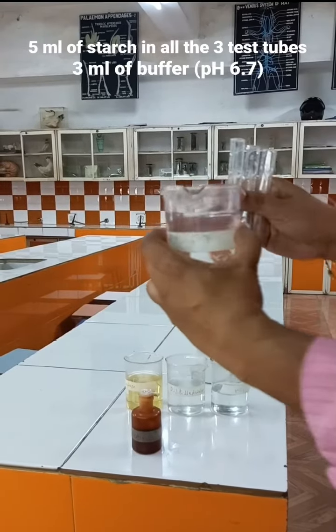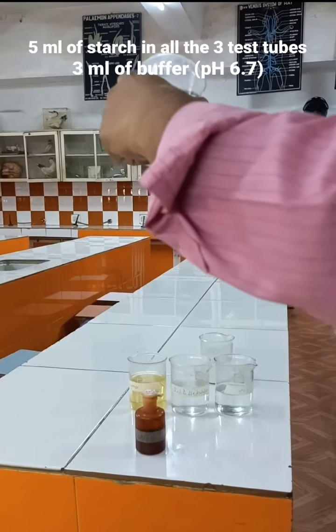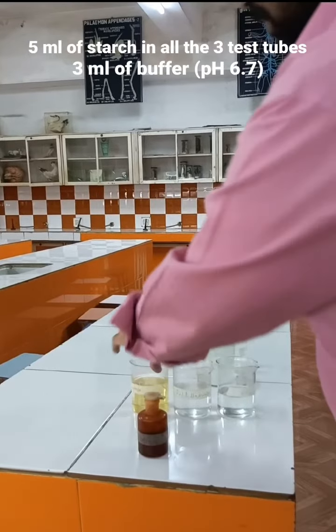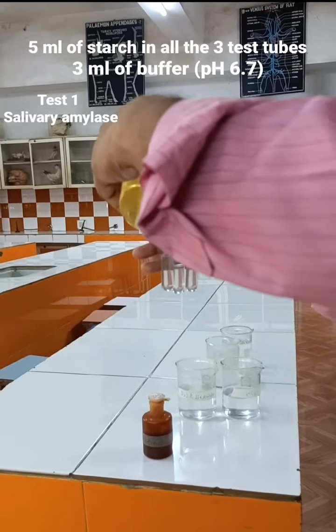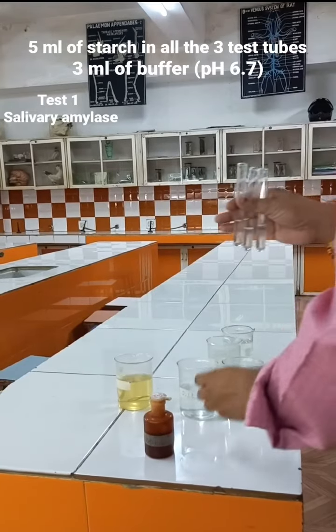To this you add 3 ml of buffer. The pH is 6.7. It's the optimum pH for enzymatic activity. So in all the 3 test tubes I've taken 3 ml of buffer solution. Now in test tube number 1, you take salivary amylase. So I've taken salivary amylase in test tube number 1.